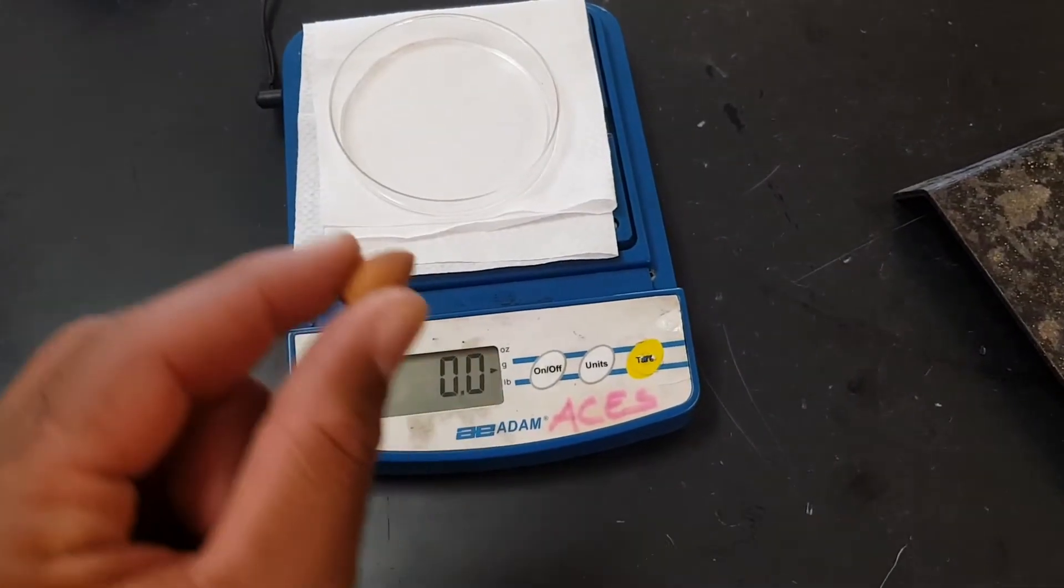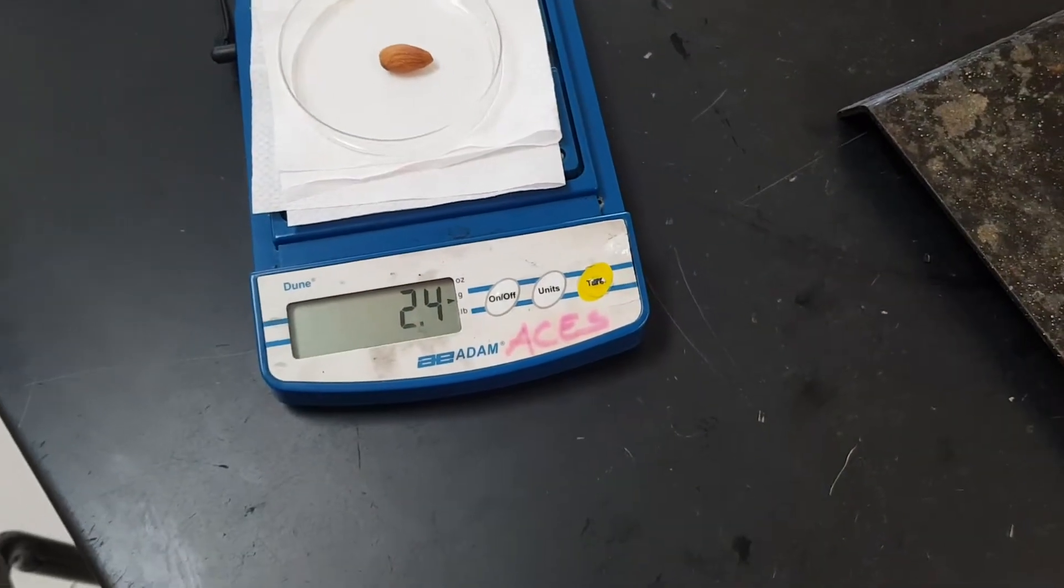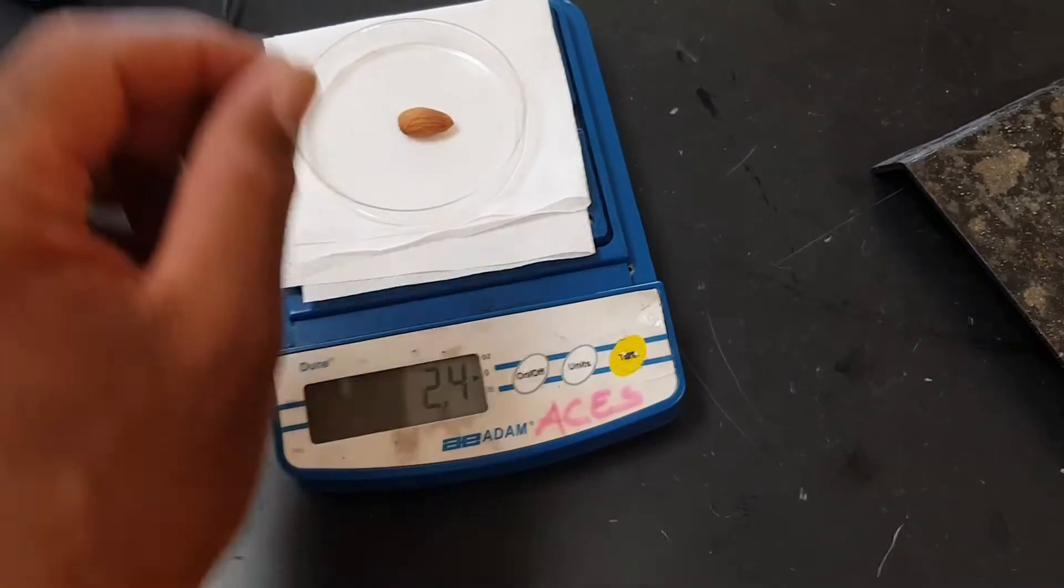Next step is to measure the mass of your nut. The mass of that nut is 2.4 grams.